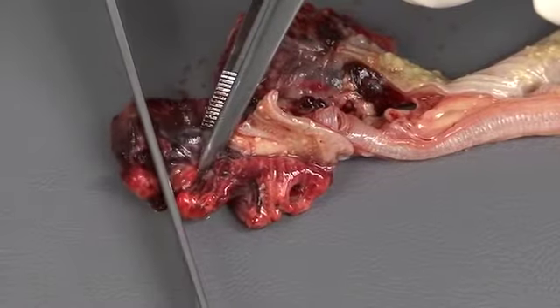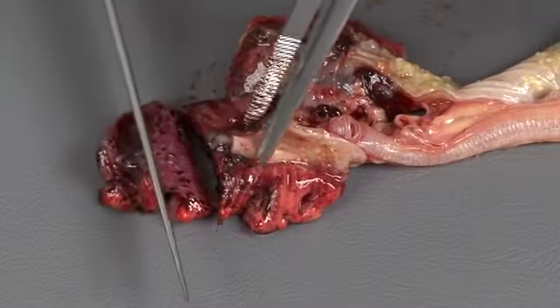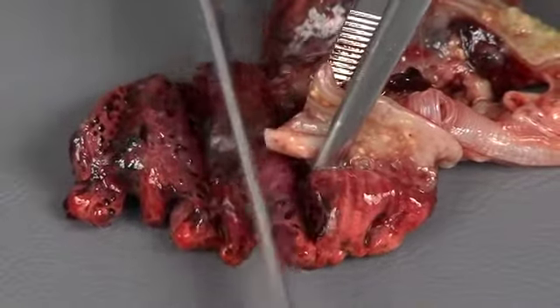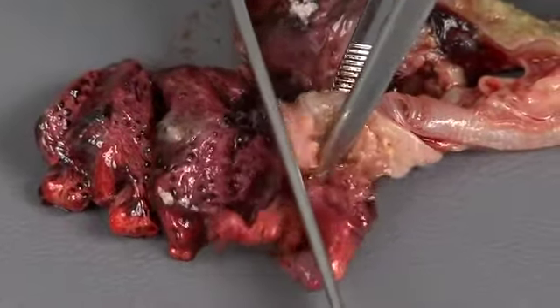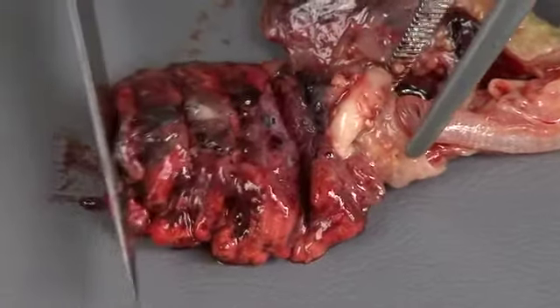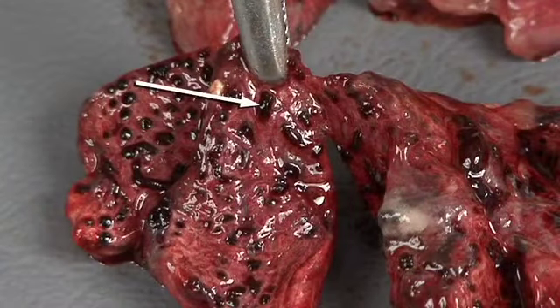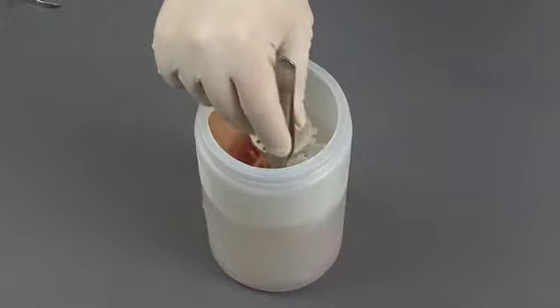Use a sharp blade to make a series of parallel cuts through the tissue. As you cut, be aware of the consistency and texture of the lungs. Focal or regional changes may indicate a lesion. It's normal for a small amount of fluid to ooze from the cut surface of the lungs. Inflammation may result in an abnormal amount of thicker, more opaque fluid. Postmortem congestion can produce dilated vessels, engorged with blood. Select any lesions along with 1 or 2 sites to sample from each lung and place the samples in formalin.